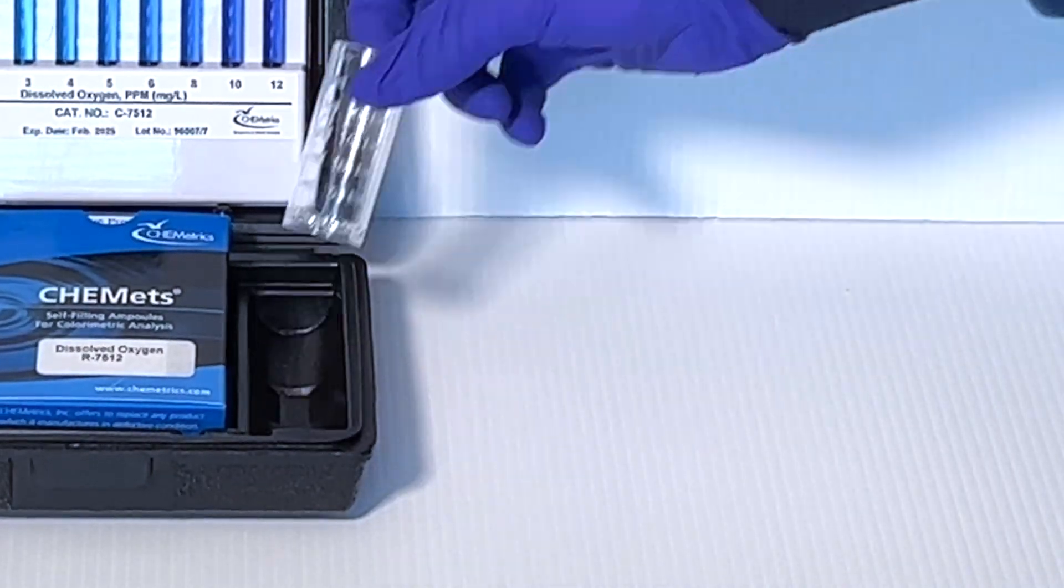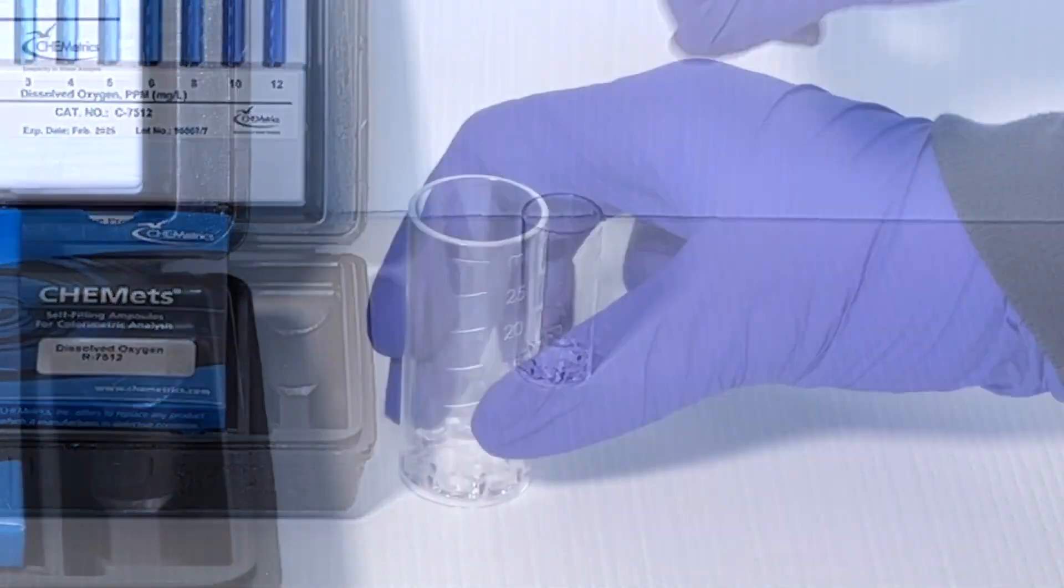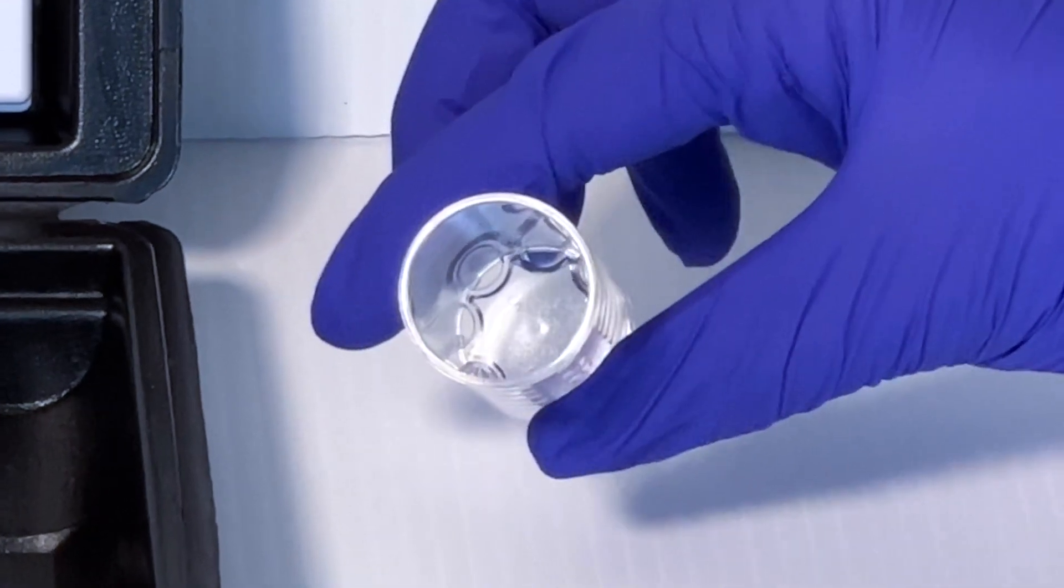First, locate the 25 milliliter cup supplied with your kit. Note the notches in the bottom of the cup.